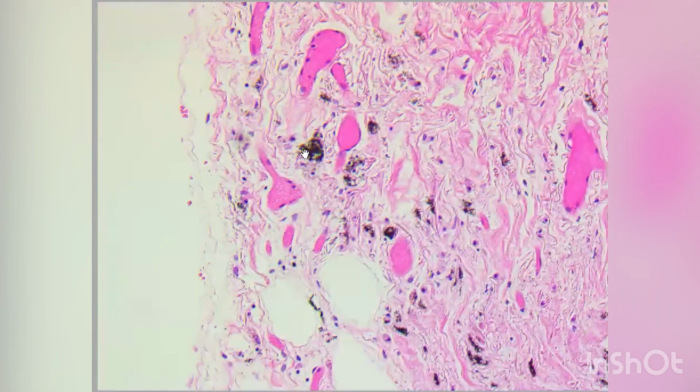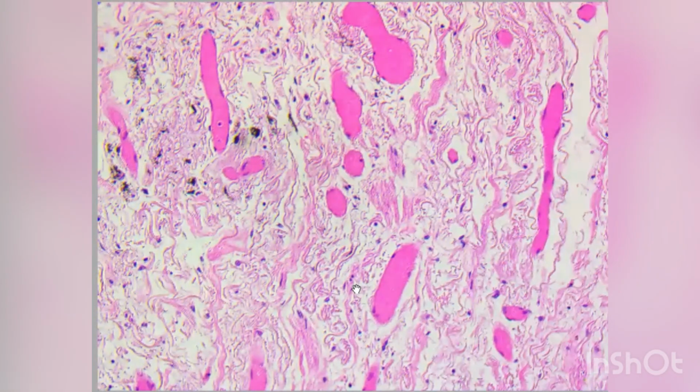Now this is again the subpleural area. We can see here anthracosis, which we find in many lung sections, or what we call anthracotic laden macrophages, surrounded by blood vessels, and these are other cystic dilatations. For this section, I'll just stop here a bit. If you saw this section without moving the slide, maybe you could not identify that this is lung tissue because of this massive fibrosis.